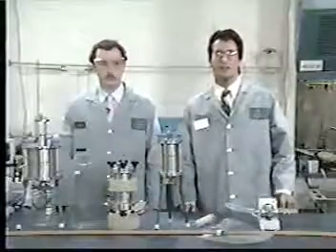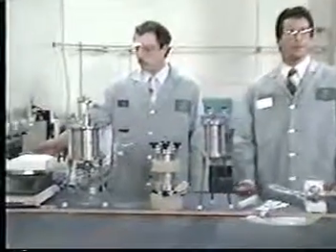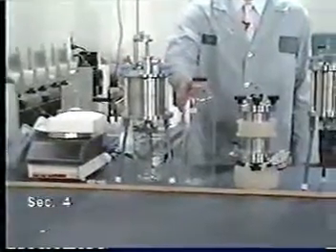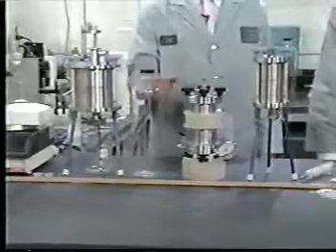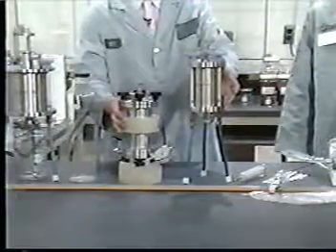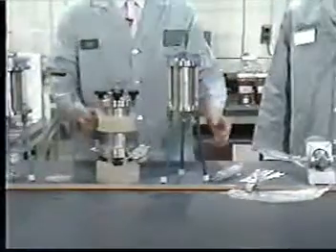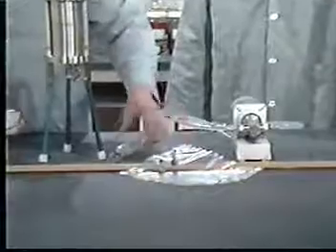Here's a brief list of the apparatus which will be used during the demonstration. The glass fiber filter and the filtration apparatus which holds it. The borosilicate glass bottle to be used as a vessel for the extraction of non-volatiles. Two examples of the zero headspace extractor. These are both gas pressurized variety, but a mechanically pressurized version approved by EPA can also be used. Two different ZHE filtrate collection devices, the Tedlar bag and the glass syringe.